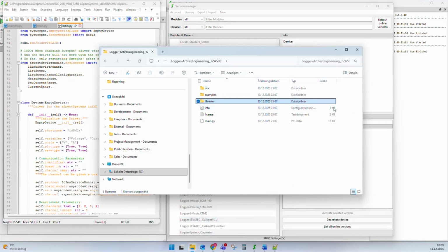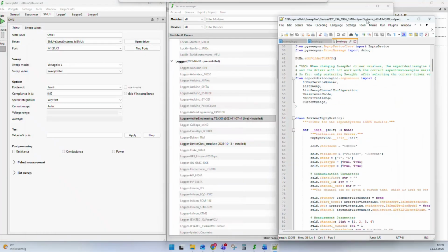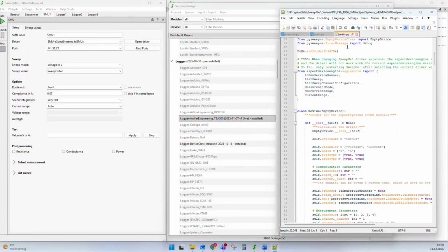Okay, so then let me have a look into my script. The philosophy of the drivers is that they are plug and play. It means that after download, you should be able to run them in a measurement without first installing libraries and so on. Often, of course, it is needed to install additional hardware drivers for your instruments. This could be something like an interface driver for the COM port, a hardware driver in the Windows system. It could also be that you sometimes have to install VISA Runtime, because SweepMe also uses VISA Runtime as a foundation for communication, especially with scientific equipment.